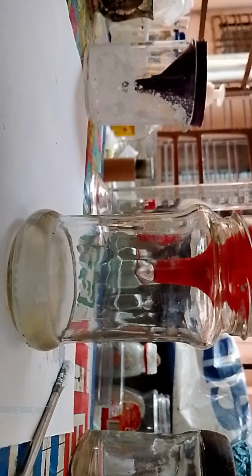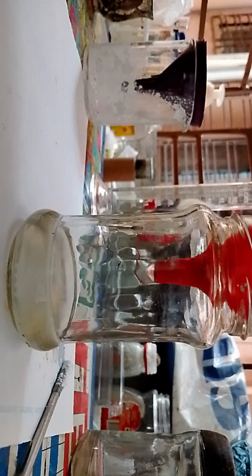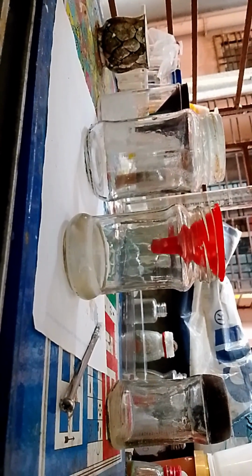Okay. The maximum of the filth is now here, as I poured it selectively. You can see inside. And now the solution is quite clear. Let it filter out, and then we will be able to peek inside and smell it.